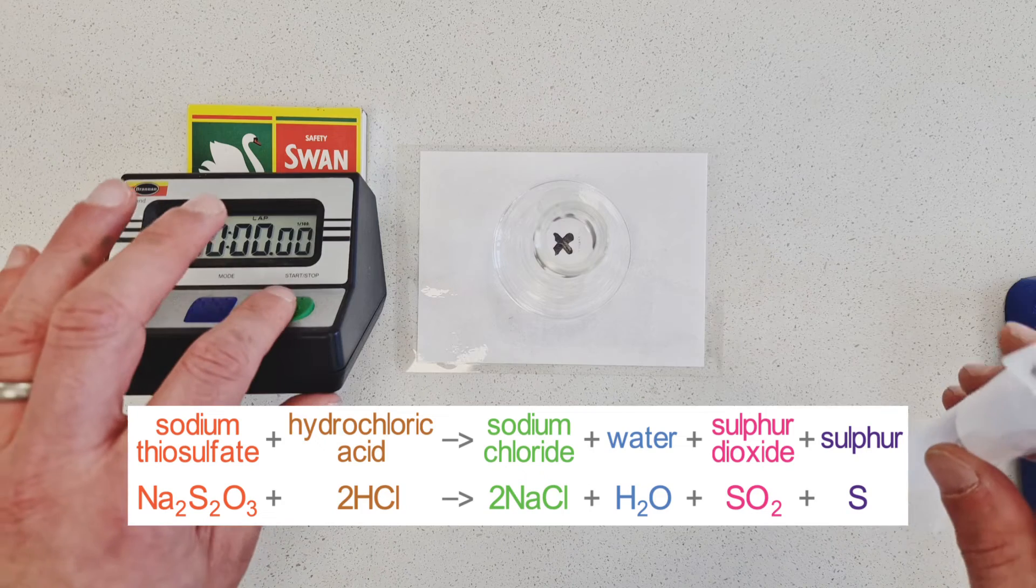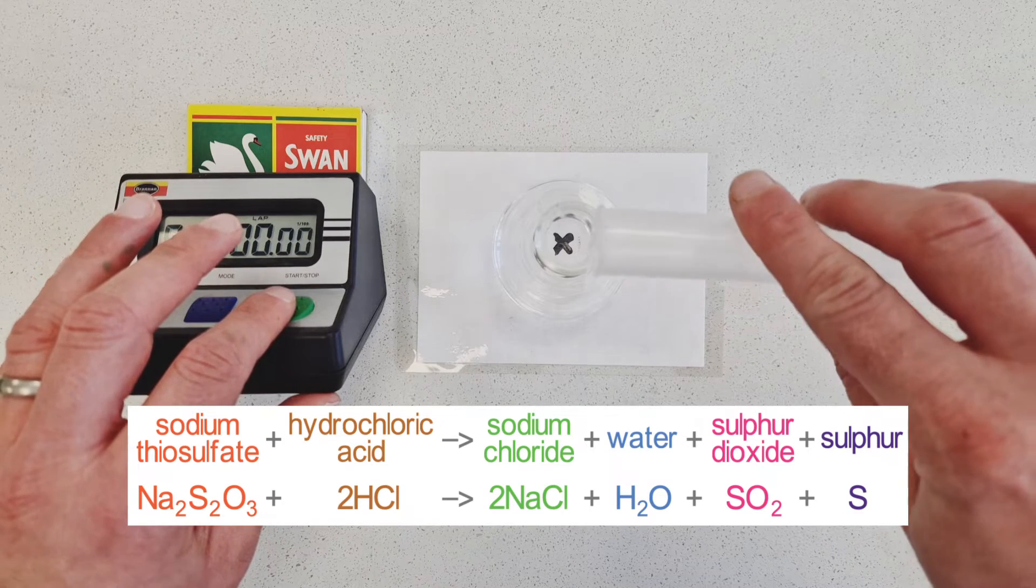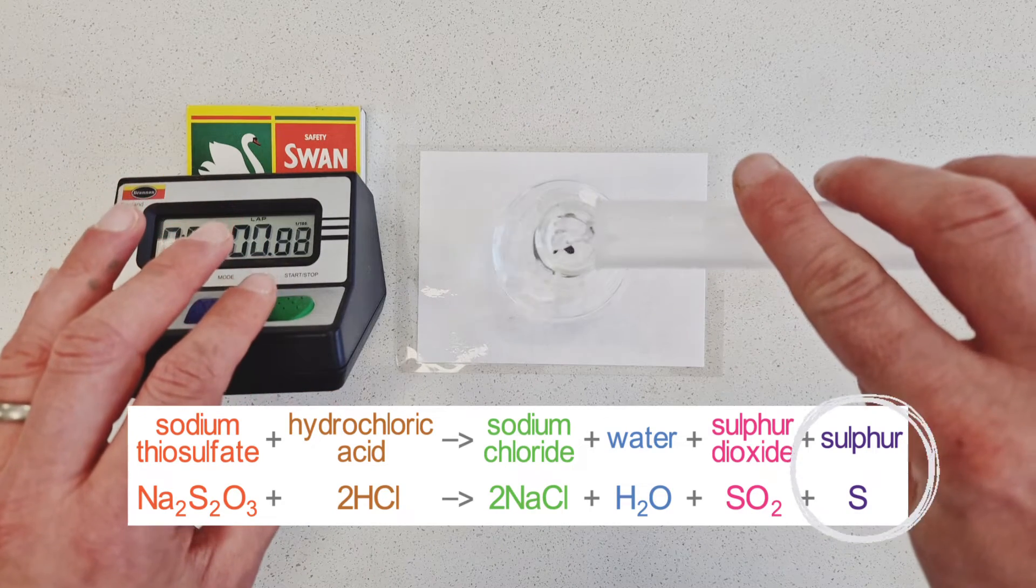This reaction produces products such as sodium chloride, water, sulphur dioxide, and most importantly, sulphur.